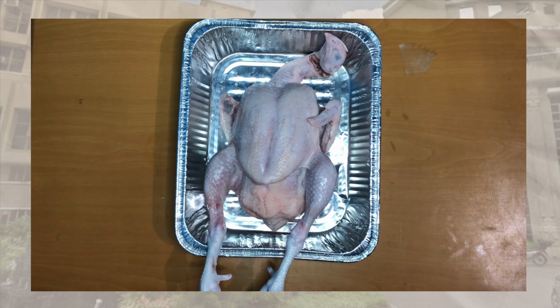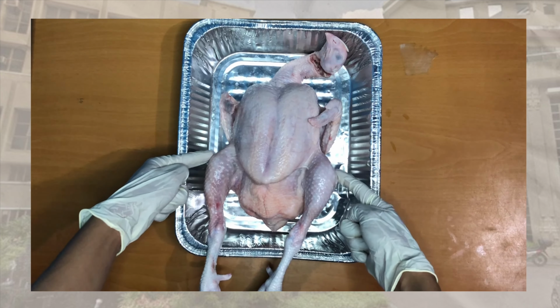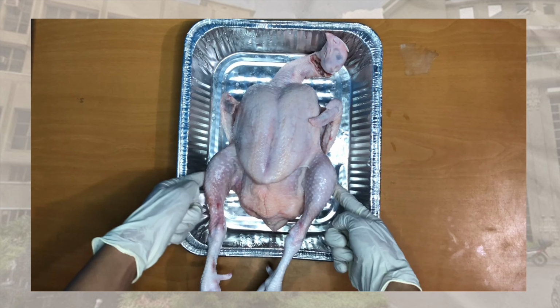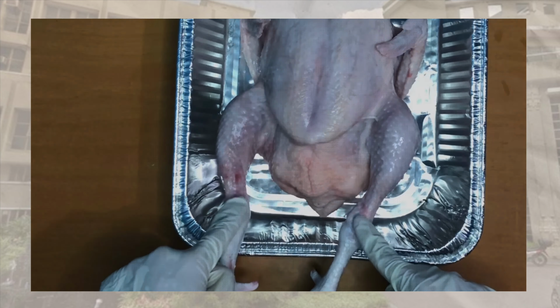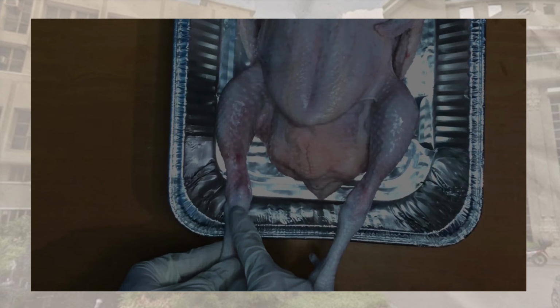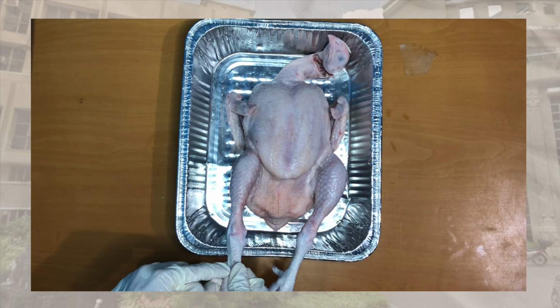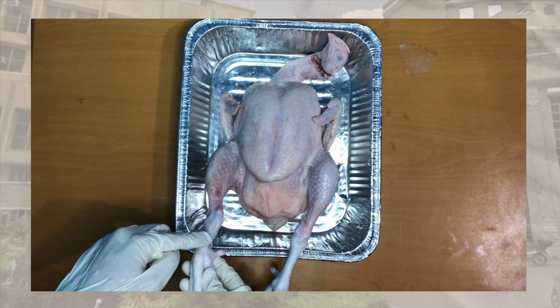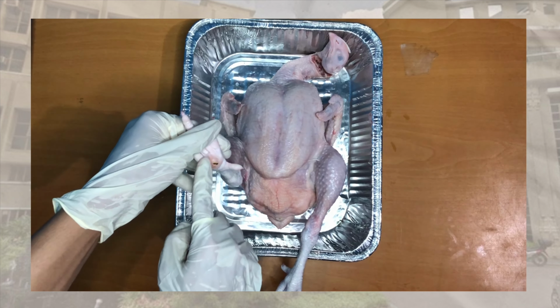While in the lower limb, there are coxal, which is also known as the hip, femoral, which is also known as the thigh, patellar, crural, which is also known as the leg, and fibular. And lastly, the pedal part of the patient consists of the following: tarsal, which is also known as the ankle, digital, and plantar.